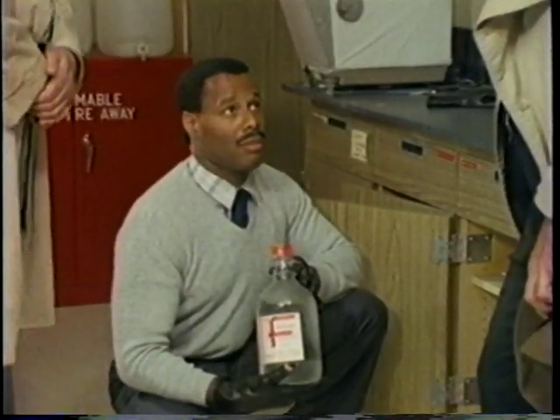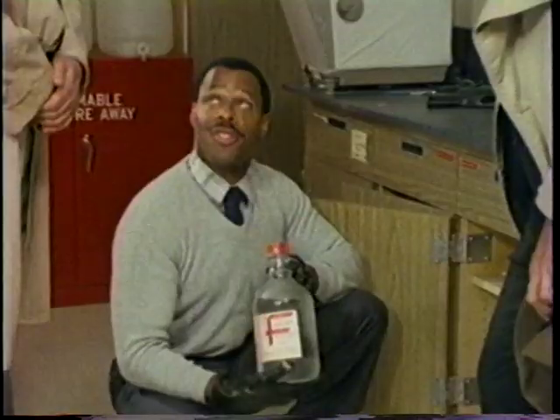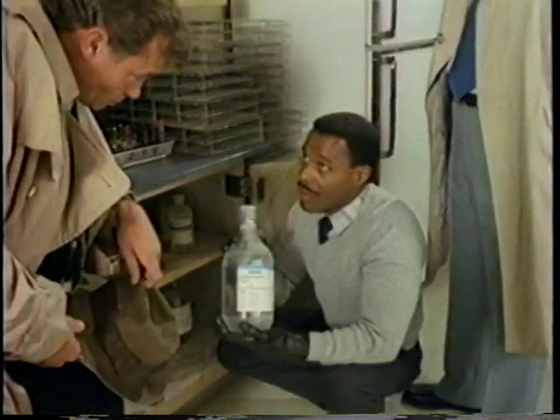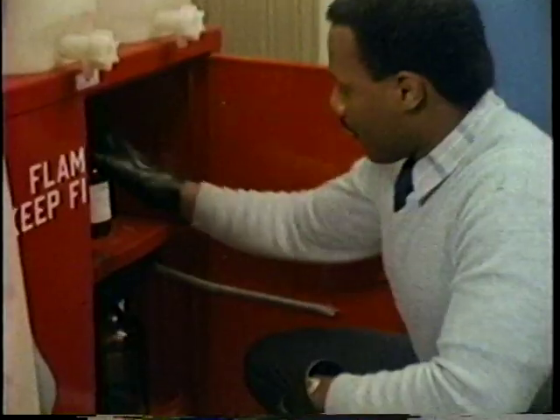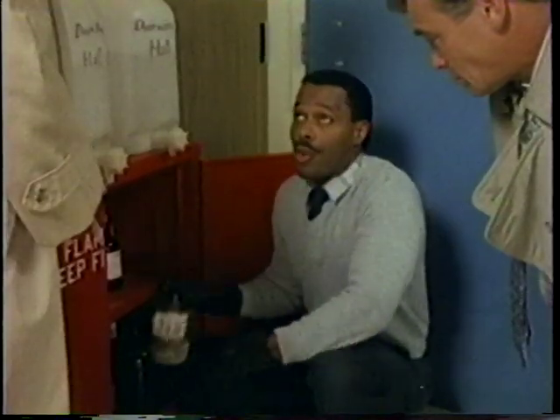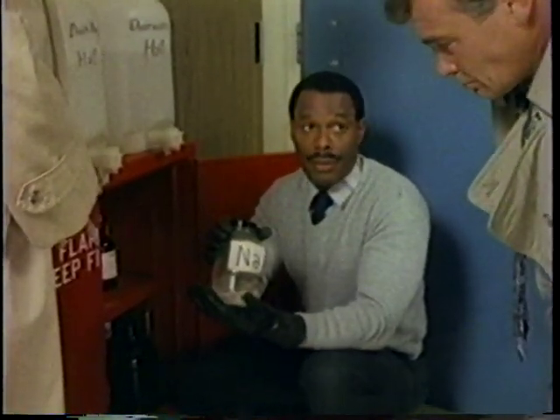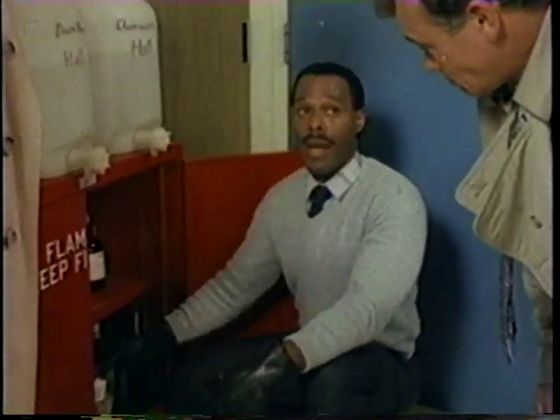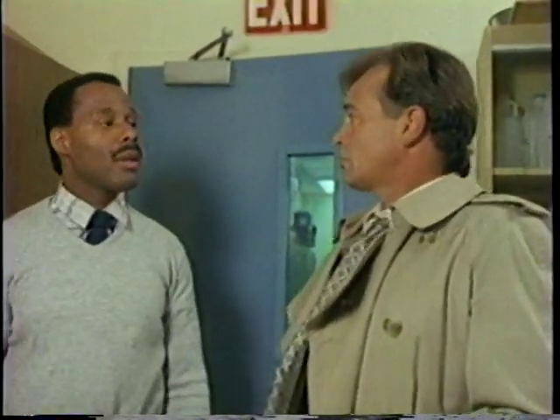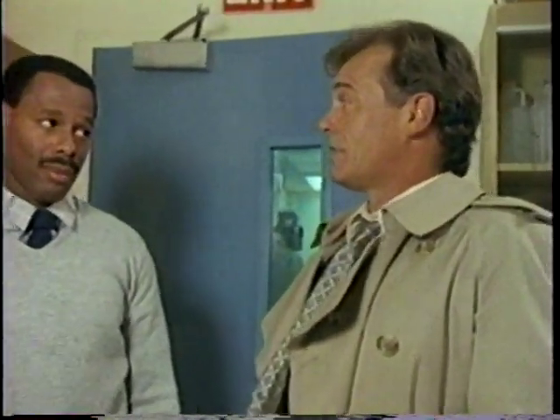You see this? Yeah. Nitric acid. One drop can burn a hole through your skin. Hydrochloric acid. Breathe too much of the fumes, and you could end up with permanent lung damage. And in here we have white phosphorus. Handle this the wrong way, watch out. Sodium. Mix this with water. Boom! Typical chem lab has hundreds of different chemicals in it. If you're not careful with them, use some the wrong way, mix two that shouldn't be mixed. Yeah, I see what you mean.